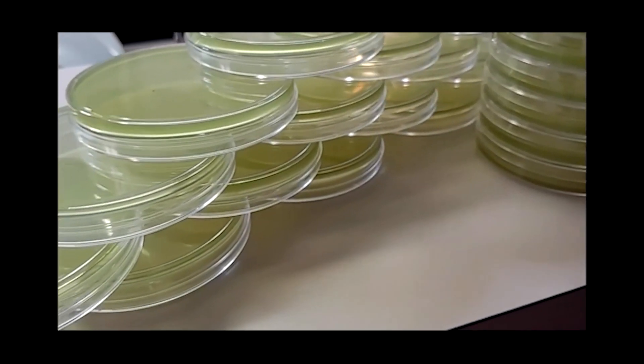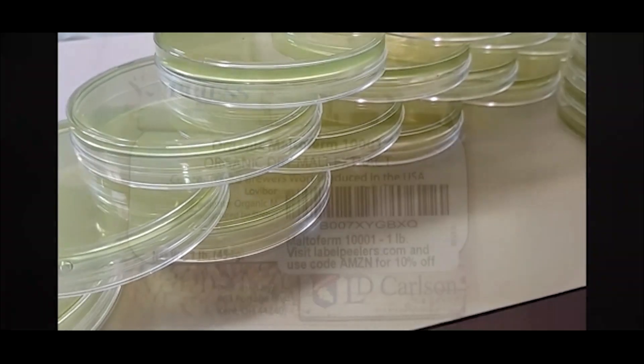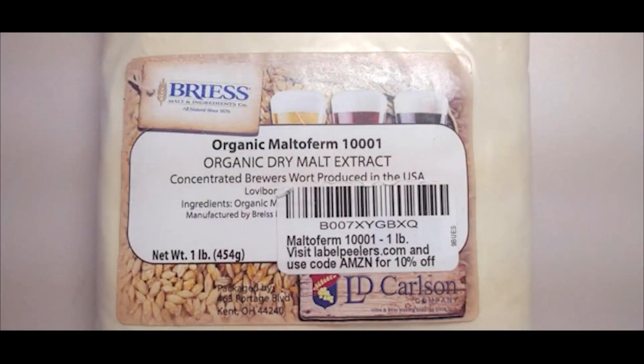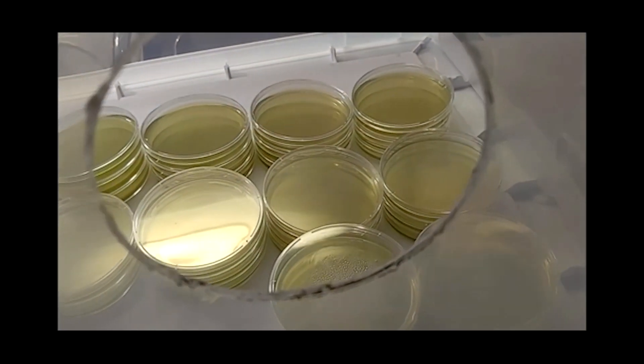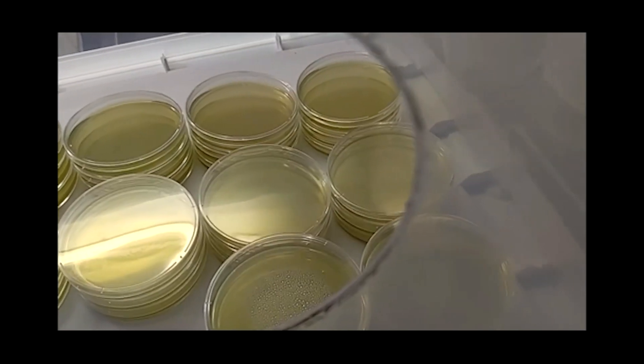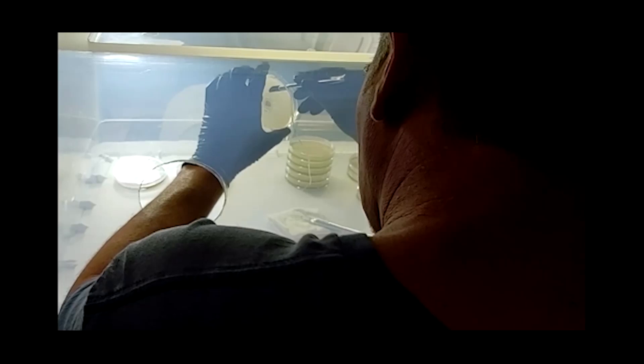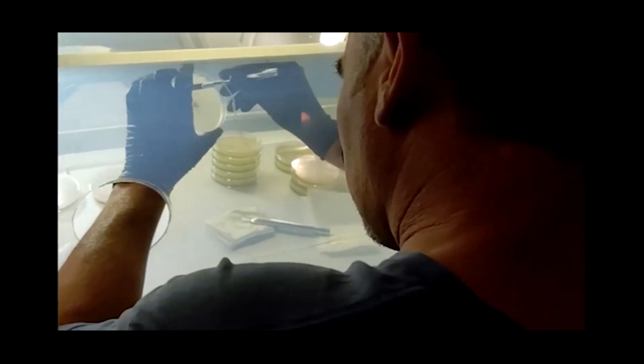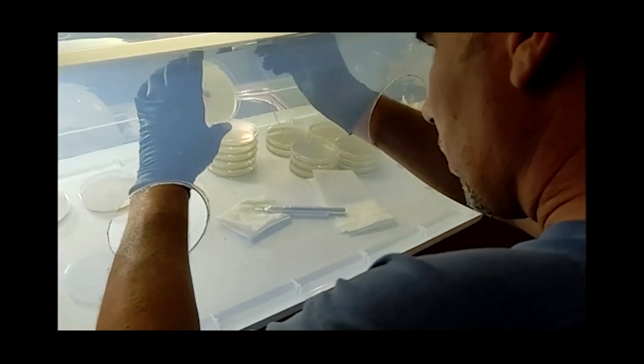MEA, or malt extract agar, is the go-to agar recipe for home mycologists. It provides the perfect adjustable recipe for growing contaminant-free mycelium cultures. The great thing we've discovered with malt extract is you can adjust the amount of nutrients and dextrose according to how much you want to feed your cultures.